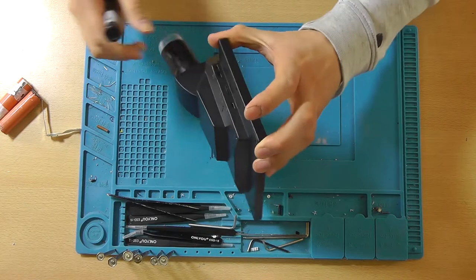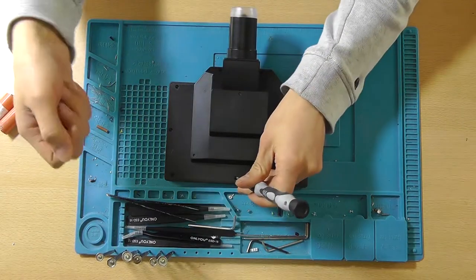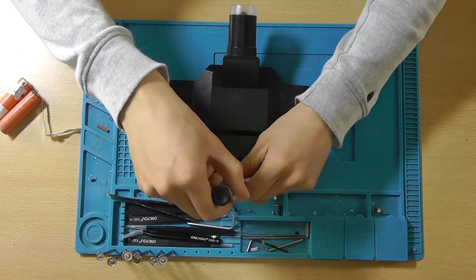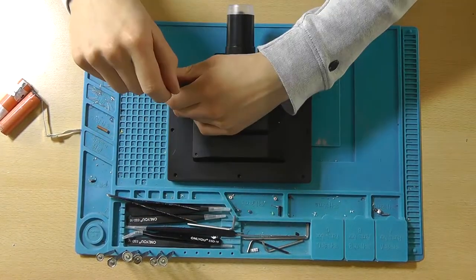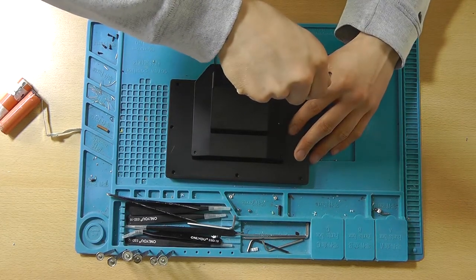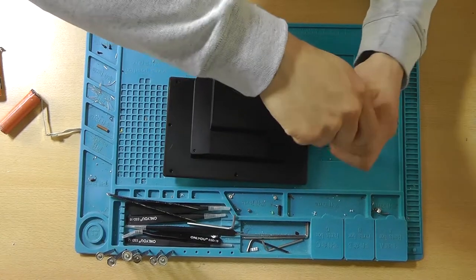Now, I'm also wanting to take a look at the SD card, why that's always hanging at the case. It's not ejecting properly. I need to go in there with one of my tweezers and push the SD card to the screen side, and then it goes flying out. So maybe we're also going to attempt to fix that. Now, I suppose when you order the model that comes with a battery, there won't be 18650s inside there. It's most likely going to be just a regular lithium ion battery cell, one of those flat things. But I'm rather confident that we've got some space over there for the battery.